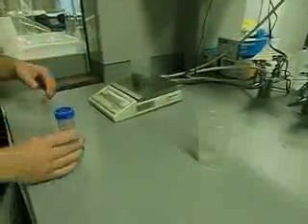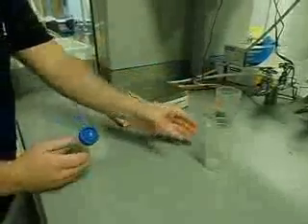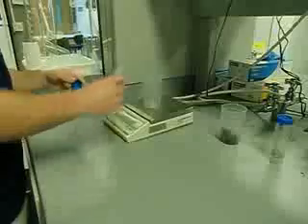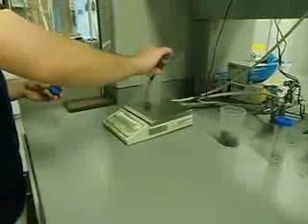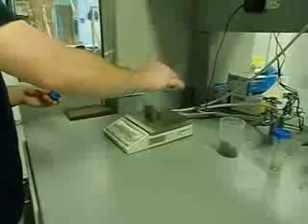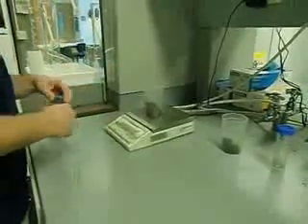Sounds good enough, right? Got 10 grams of my top layer sample. Now I'm gonna put this back, re-zero it. Of course, you have to write down every single thing you do. You make sure you take all your data. So, I'm gonna put this in, get about 10 grams again. Oops, that went over a little bit.